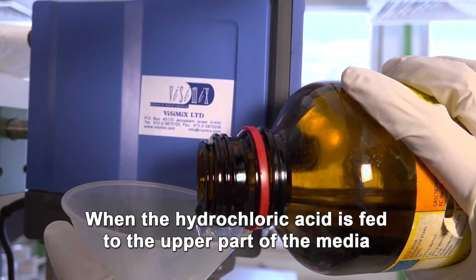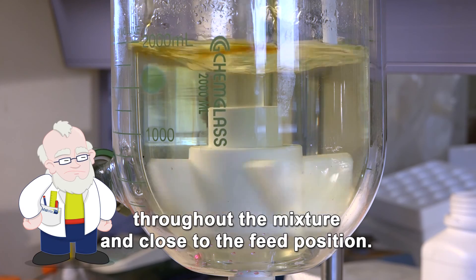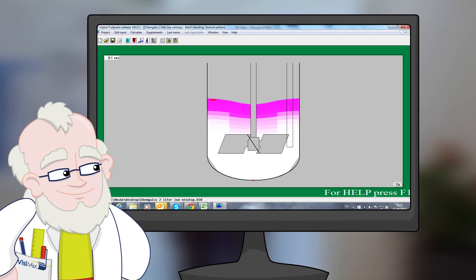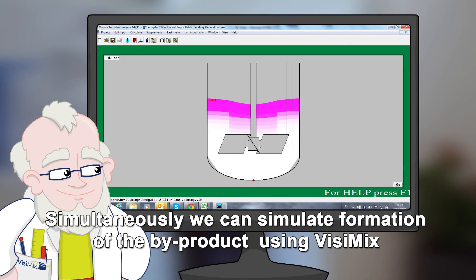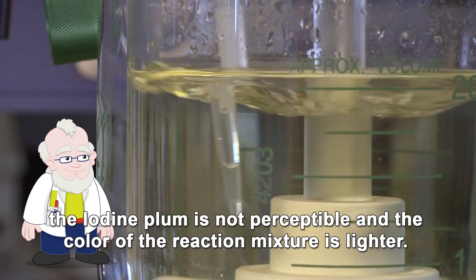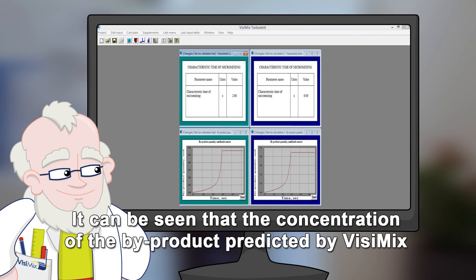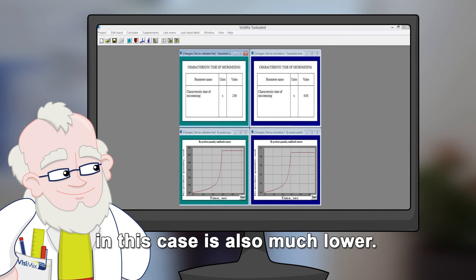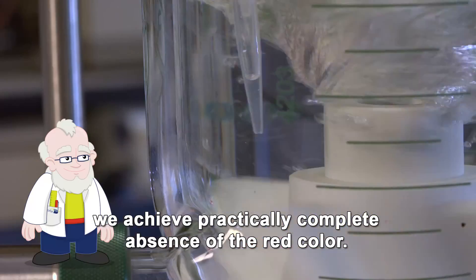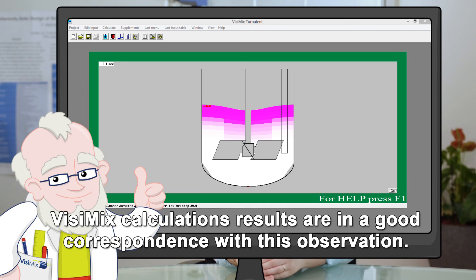When the hydrochloric acid is fed to the upper part of the media and the impeller rotation velocity is low, we also observe the red color throughout the mixture and close to the feed position — we see a plume of the by-product iodine generated close to the exit of the feed tube. Simultaneously, we can simulate formation of the by-product using VisiMix. When the feed position of the hydrochloric acid is close to the impeller, the iodine plume is not perceptible and the color of the reaction mixture is lighter. The concentration of by-products predicted by VisiMix in this case is also much lower. Finally, by increasing the impeller rotation rate, we achieve practically complete absence of the red color, indicating that the by-product is practically absent. VisiMix calculation results are in good correspondence with these observations.